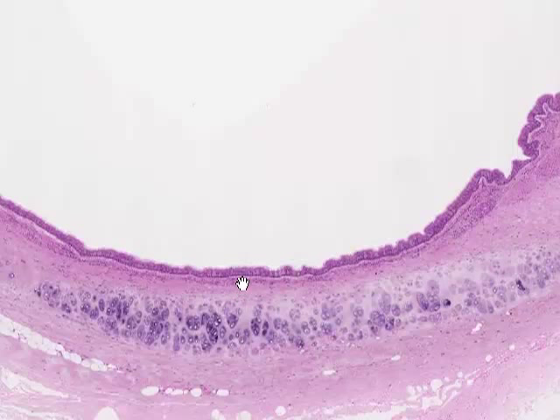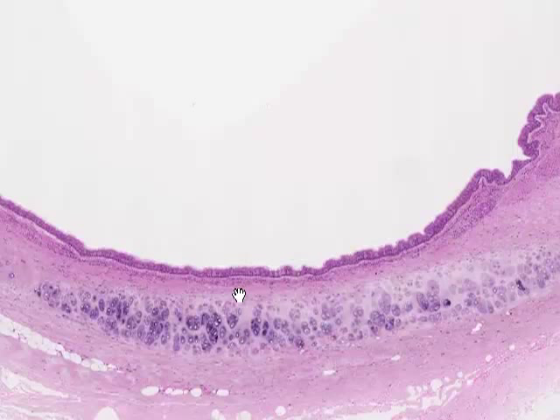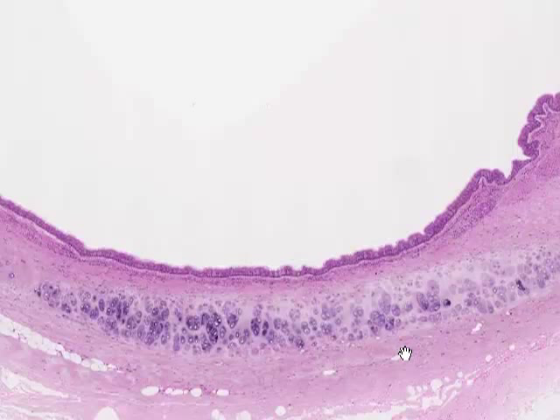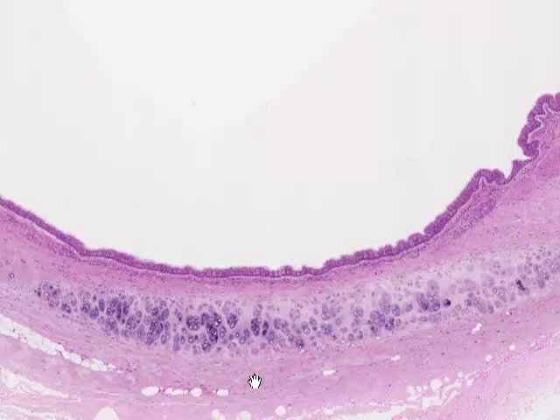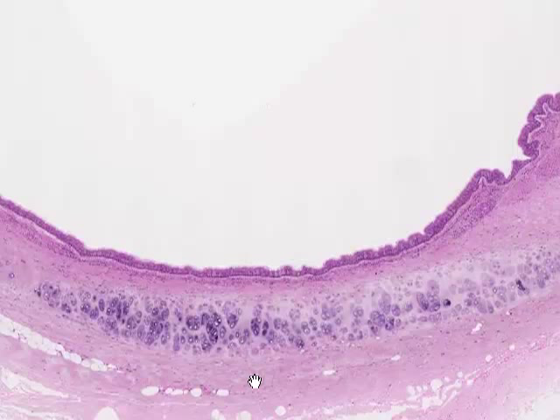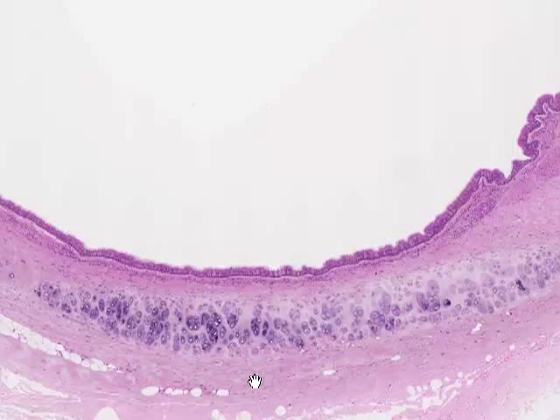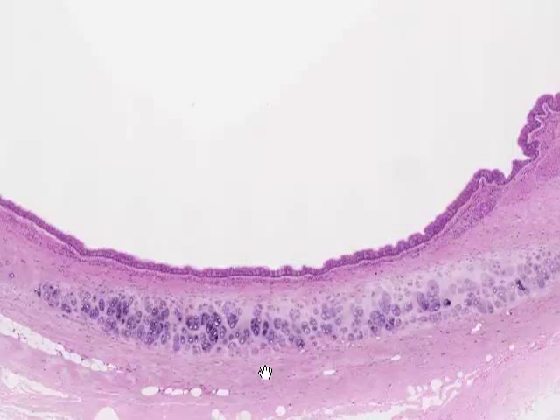Between the hyaline cartilage and the epithelium we're going to have some connective tissue, which depending on where we see it will be either dense irregular to moderately dense connective tissue. On the outer surface we'll also find some dense irregular connective tissue. One thing not very apparent at this magnification is the perichondrium — the connective tissue membrane surrounding hyaline cartilage — from which stem cells that can give rise to new chondrocytes are found, at least when the cartilage is initially developing.